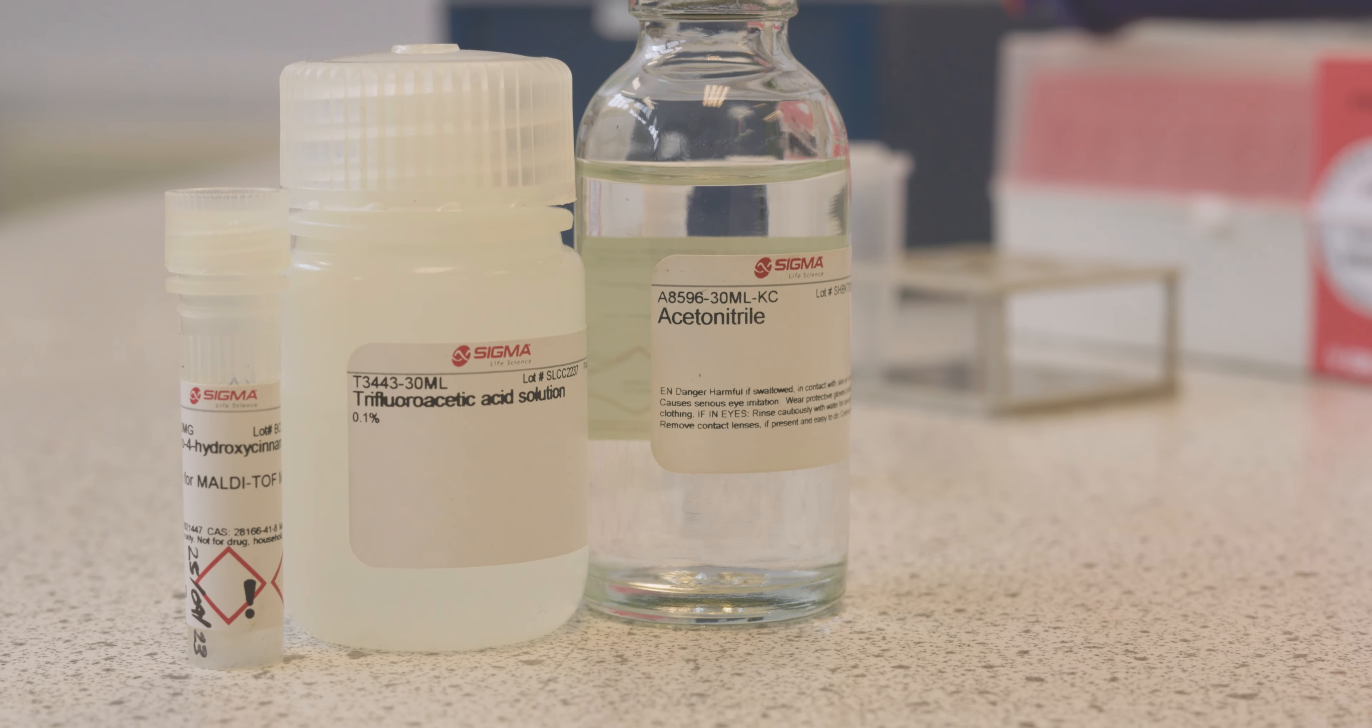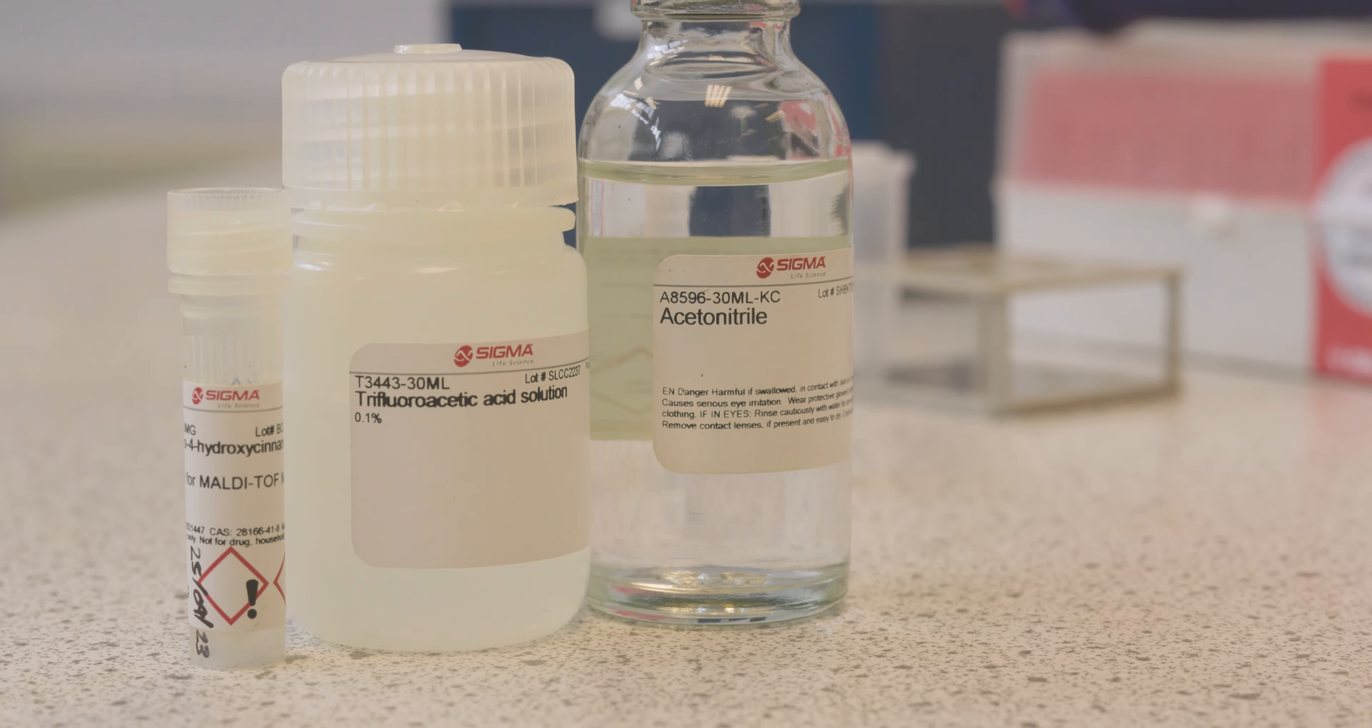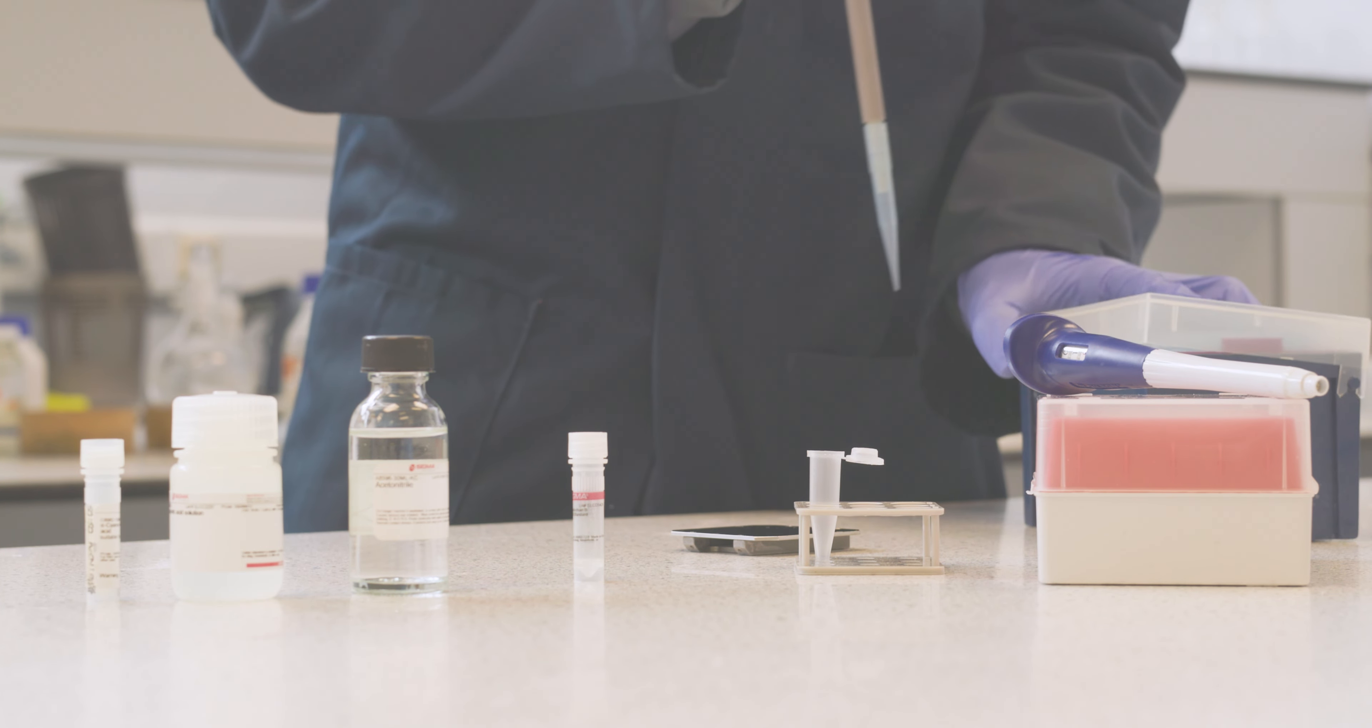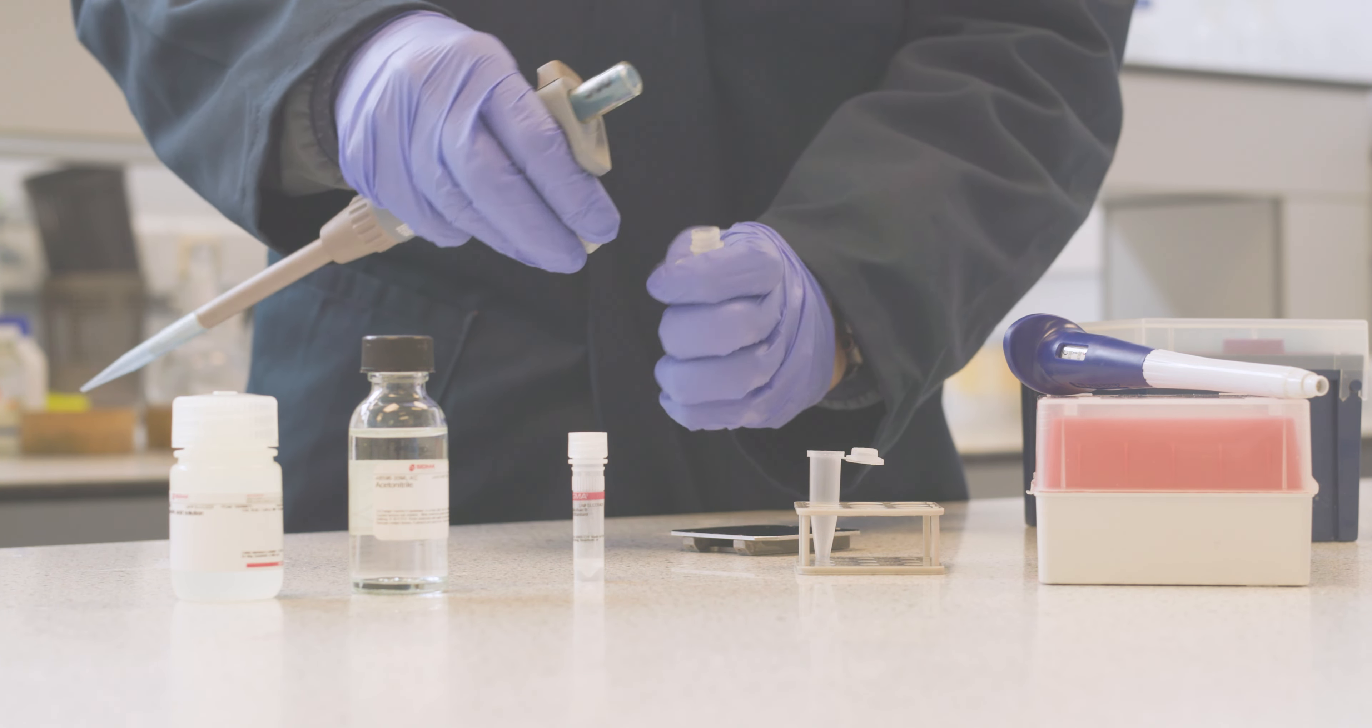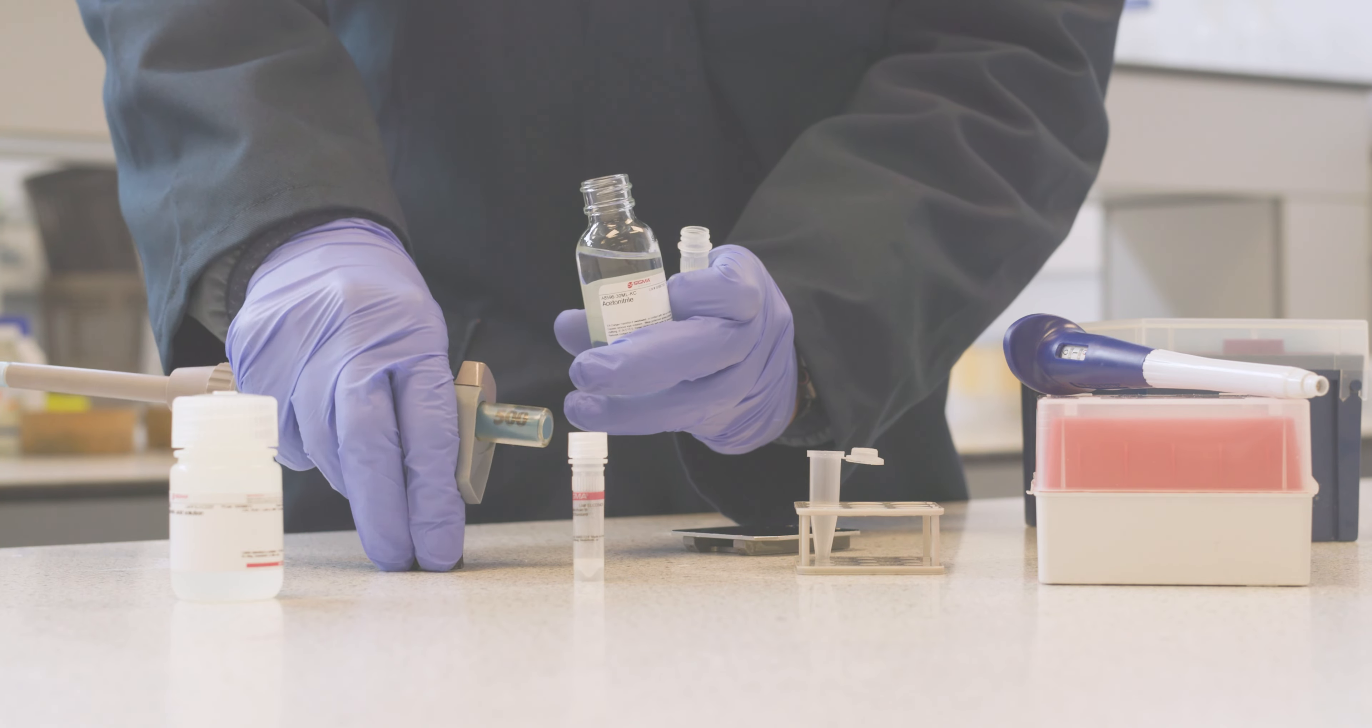Proteins and larger molecules can be analysed using mass spectrometry. We use an ionisation technique called MALDI, Matrix Assisted Laser Desorption Ionisation. This is achieved by first taking a 10mg vial of our matrix, in this case CHCA, and we're going to dissolve that matrix in a solvent.